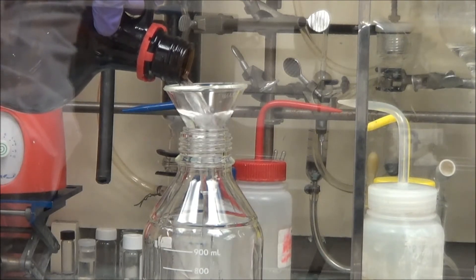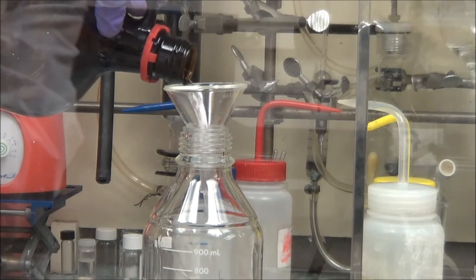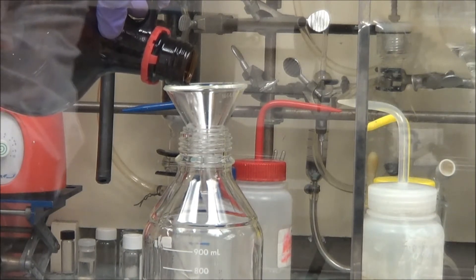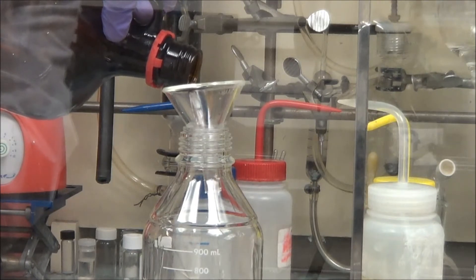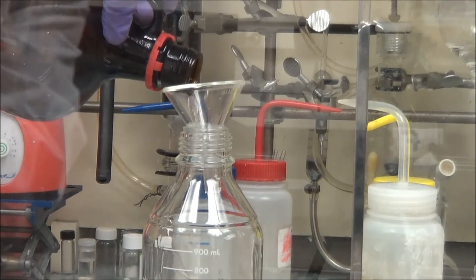And we're going to make a 90% acetonitrile, 10% oleic acid solution, typically 20 mLs of oleic acid with 180 of acetonitrile. You don't have to be very accurate with this in all honesty.